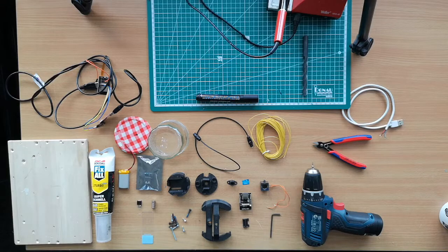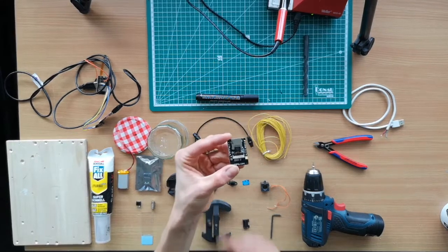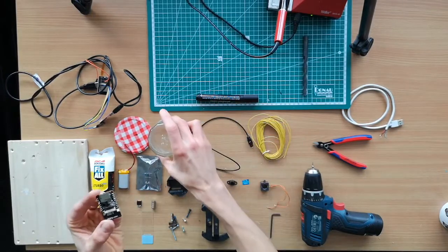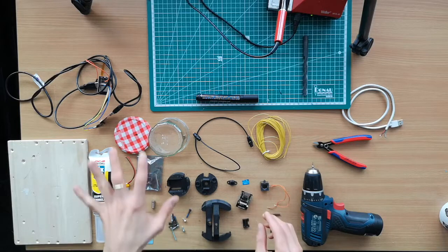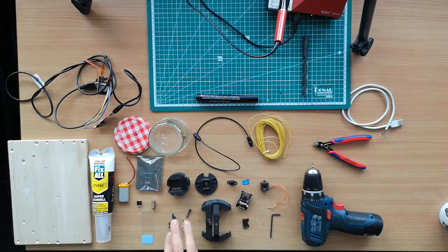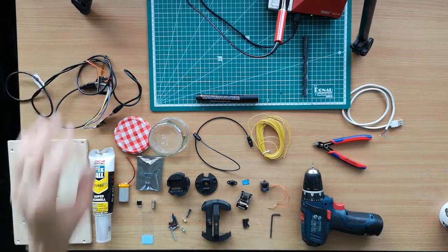Okay, so today we are assembling the Anglerfish. It's going to be an ESP32 driven microscope inside a jar that's widely available. So it's a Bonne Maman jar with your favorite marmalade. And what we have here are all the parts we need: the glass, some wires, 3D printed parts, the screws, some electronics, and some tools, and also the programmer.